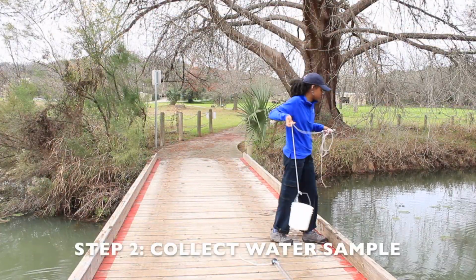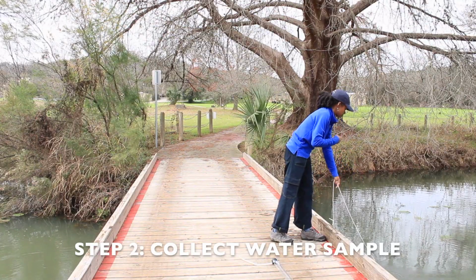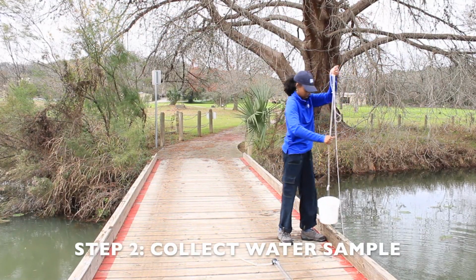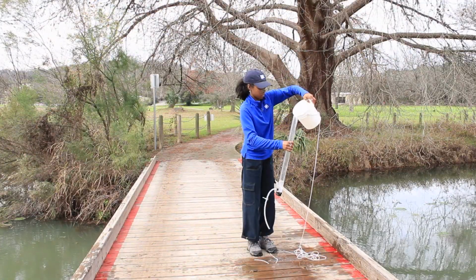For step 2, collect your sample water with the bucket, making sure not to disrupt any sediment. Fill the transparency tube with your sample water from your bucket grab.